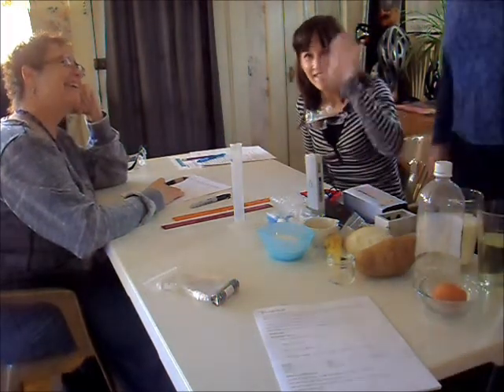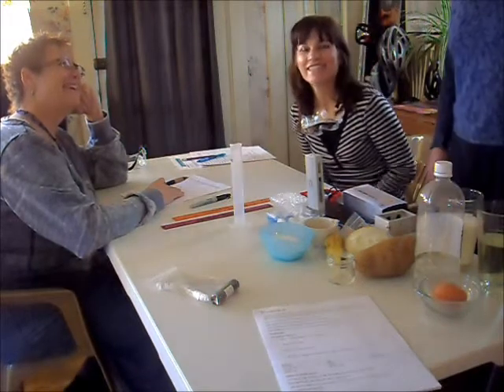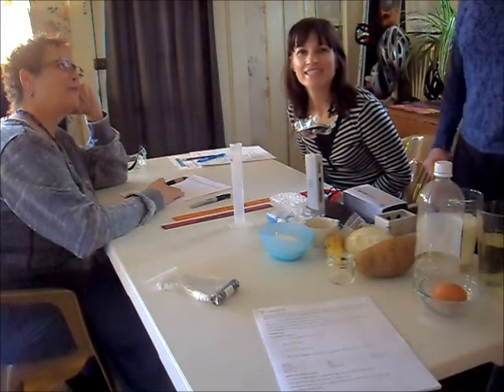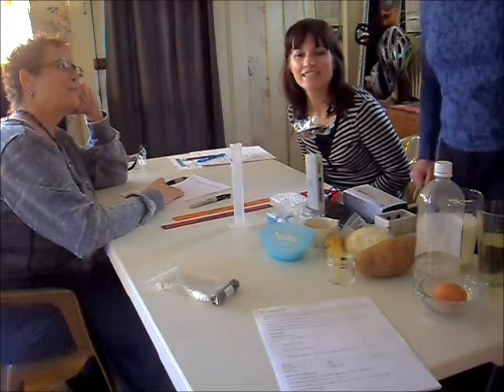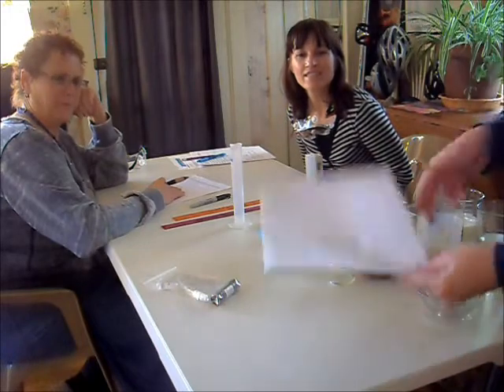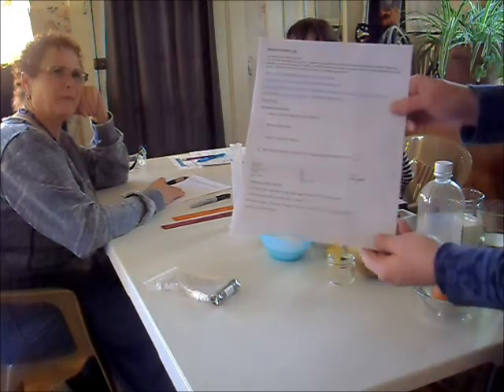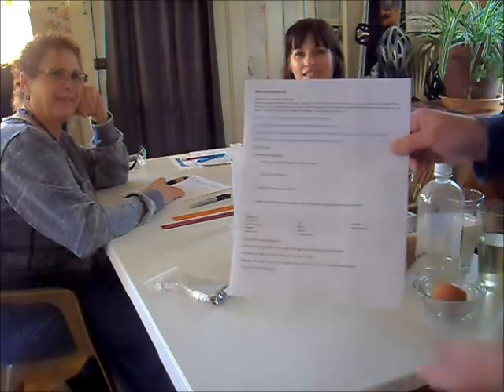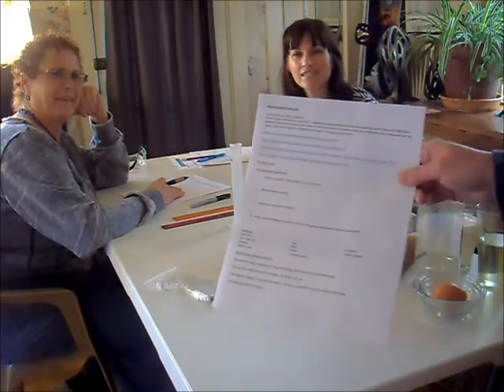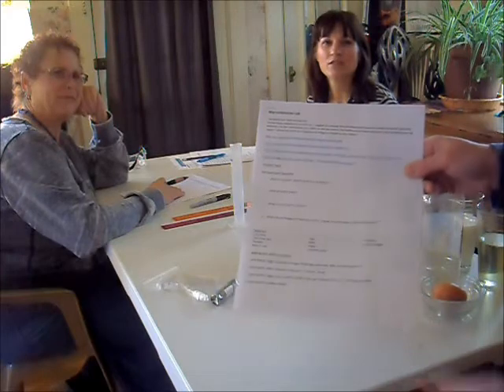Hello everyone, we are making a video of the Macromolecules Lab. You should be looking at this document, which you can find on Blackboard in the course documents.